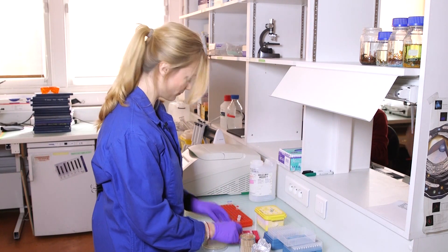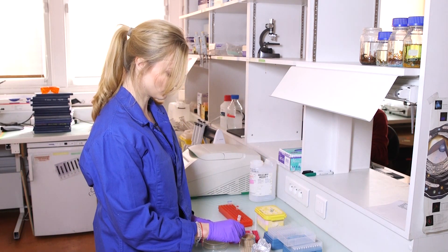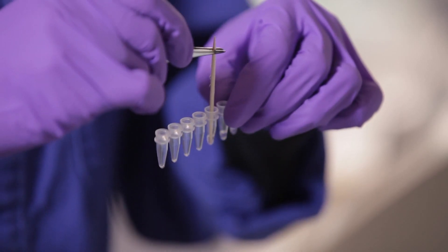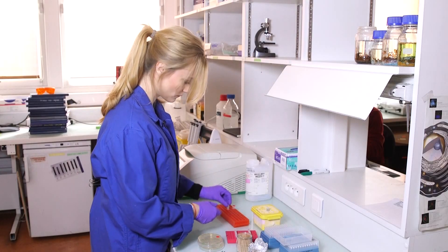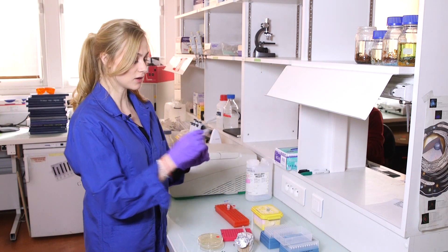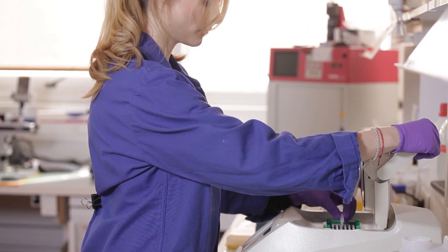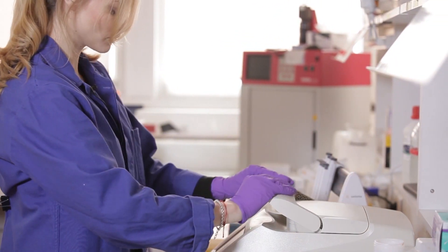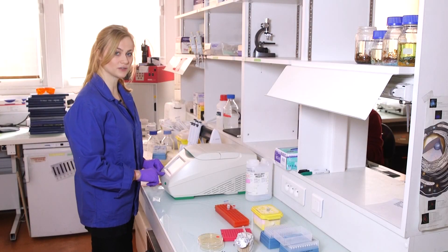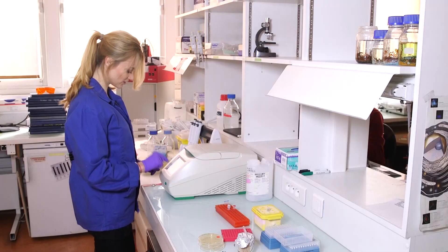And finally, the negative control. So that's step one. Now we need to go to the PCR machine to heat the different tubes. I put them inside the machine and I set the temperature at 98 degrees. Ten minutes should be good. I press start.